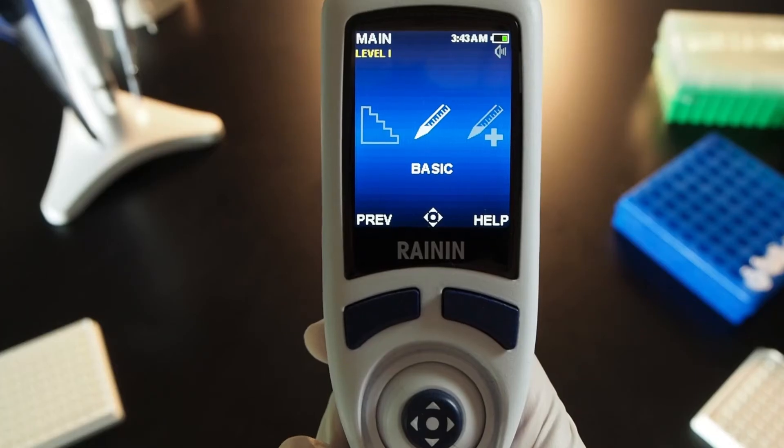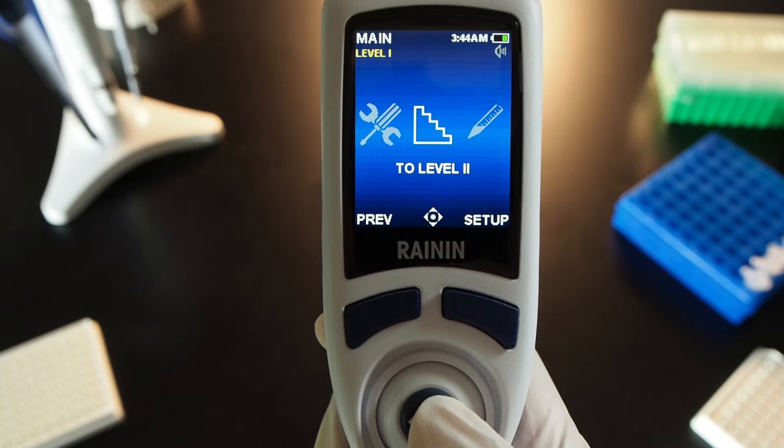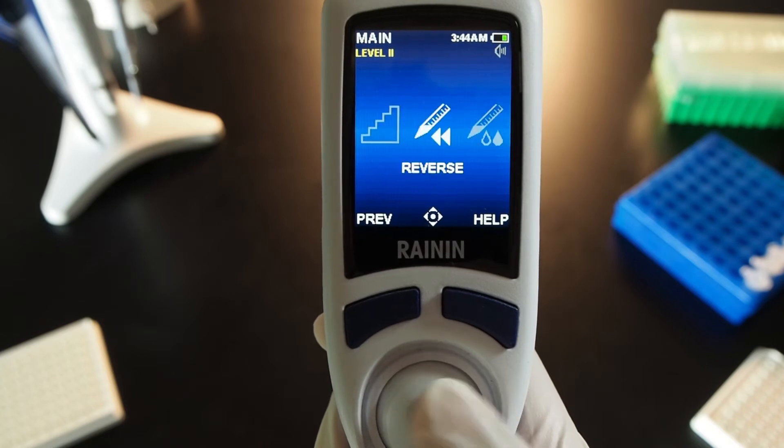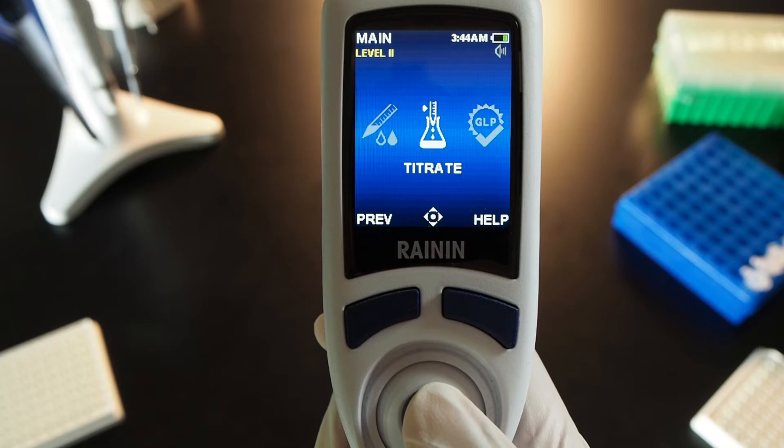Move the joystick right or left to the level 2 staircase icon and push up. Joystick right to titrate and push the joystick up to choose it.